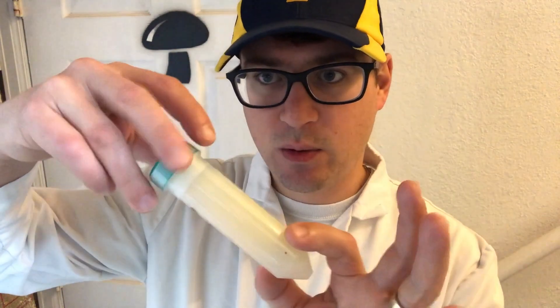You can completely seal the centrifuge tubes, which means the parafilm here is just for extra protection, mostly during shipping or when I'm moving my stock from one lab to another. It's really important to have your backup cultures — which are usually on slants — protected from any contamination.